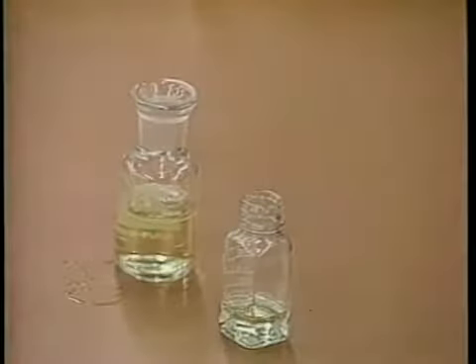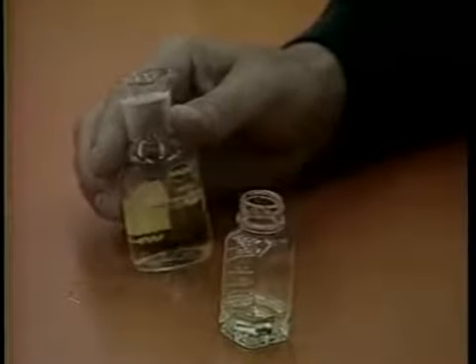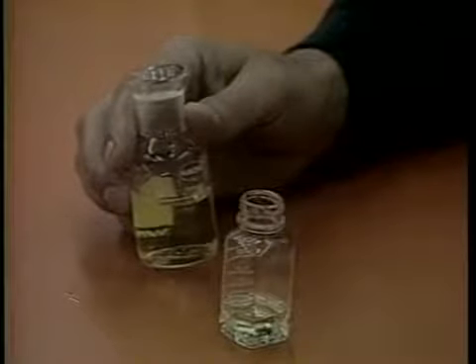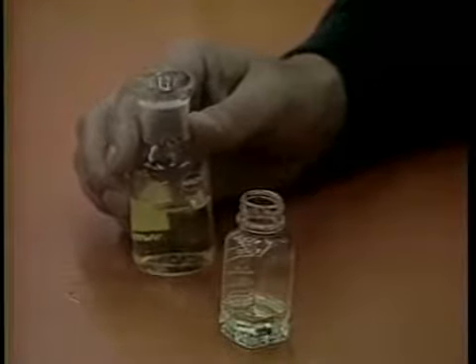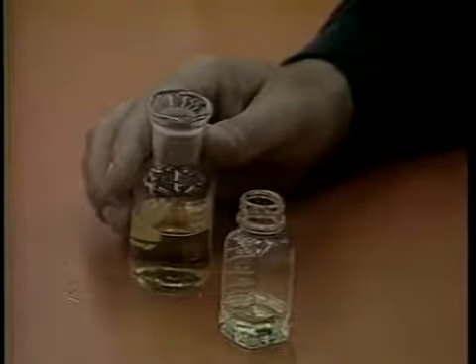If the results obtained in the high-range test are below 3 milligrams per liter or parts per million, proceed with the low-range test. In the low-range test, a larger prepared sample is used, which results in a greater sensitivity at low dissolved oxygen concentrations. To measure the dissolved oxygen using the low-range test, proceed as follows.